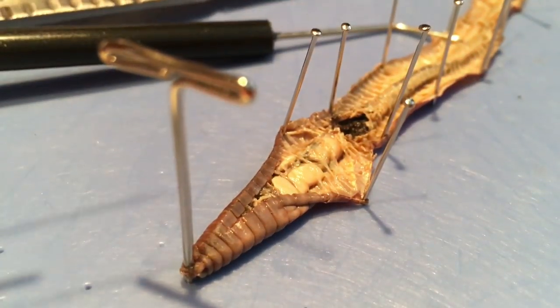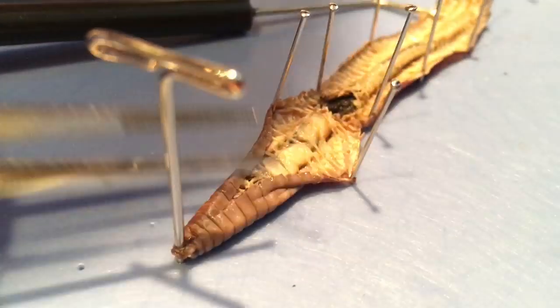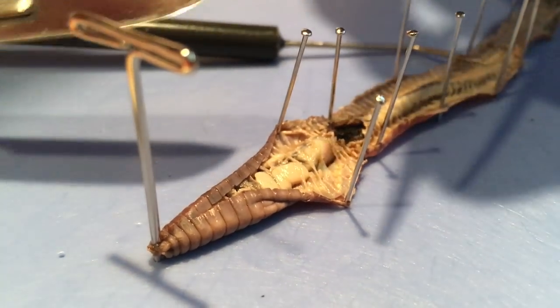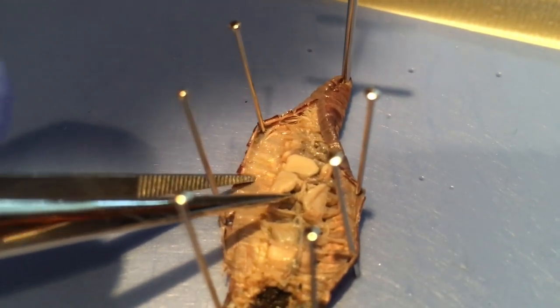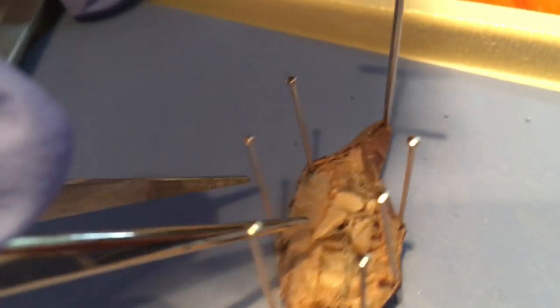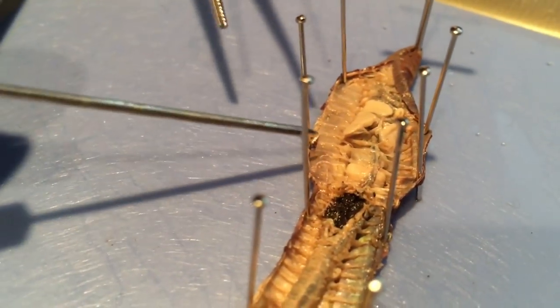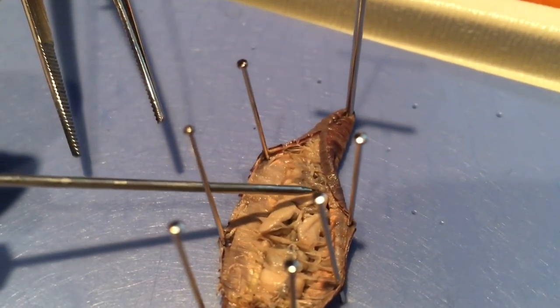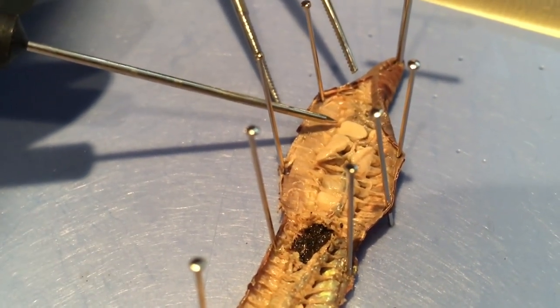Put it back a little bit more towards the tip and see if we can see some heart action. Do you need to cut some tissue? Yeah, I need to cut the tissue. So tell me what you see in here — I see one of those hearts. That is so neat. There's the gizzard. I can poke at it. Gizzard. One heart, two heart, three heart, four heart, five heart, six heart, seven heart. The three hearts over here are clumped together — they are so tiny, sticking right out of here.